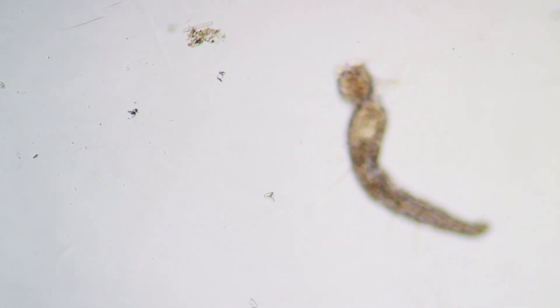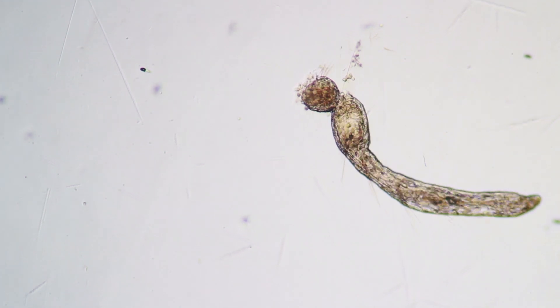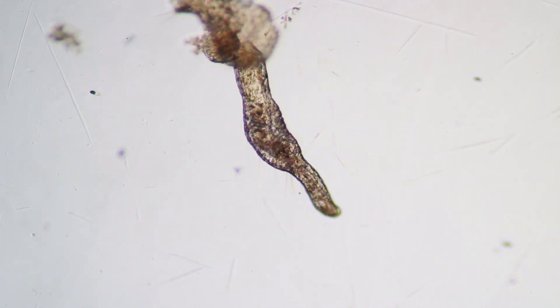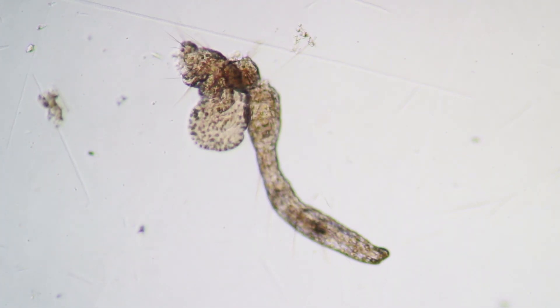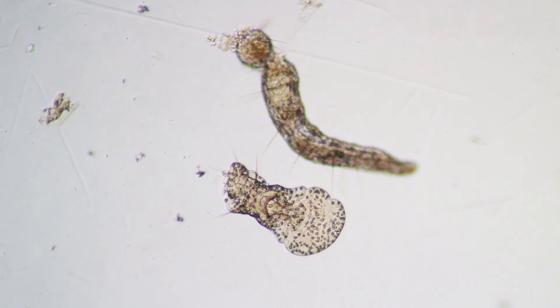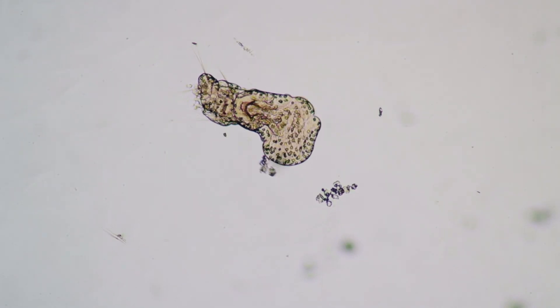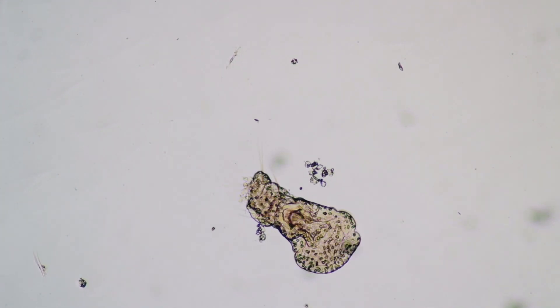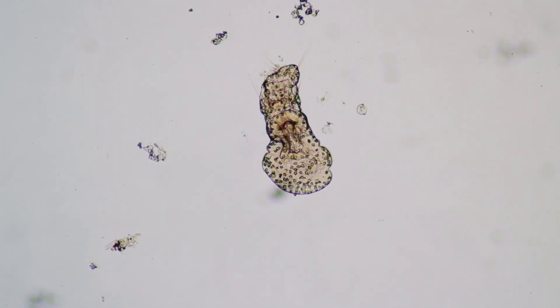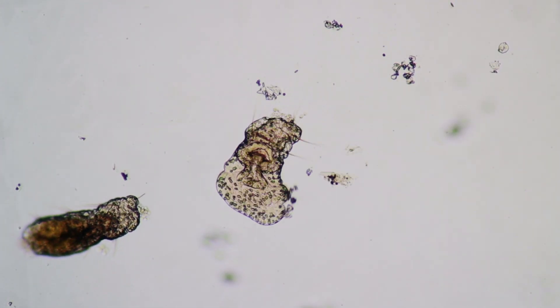All of a sudden the head found something — it found the rest of the body! You can see the rest of the body is still moving as well, which actually shows that it has a very decentralized nervous system. The head meets the body — 'do I know you from somewhere?' In any case, the head later continues to grow the rest of the body, while the body itself did not seem to develop very well, which is not surprising because without a head it's not able to eat anything.